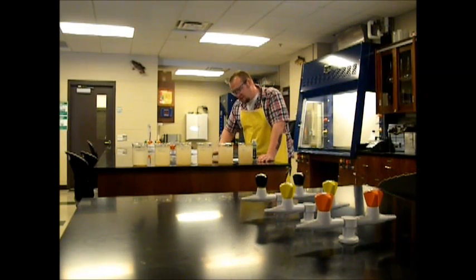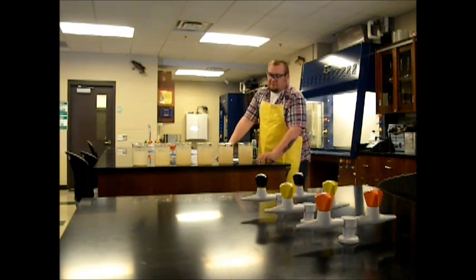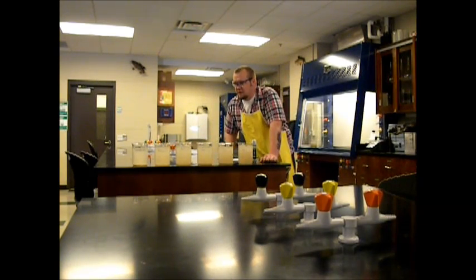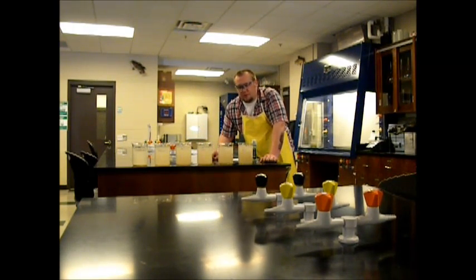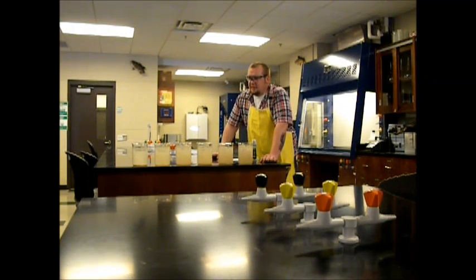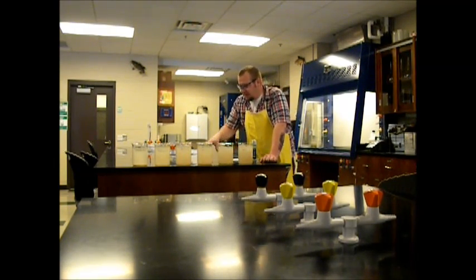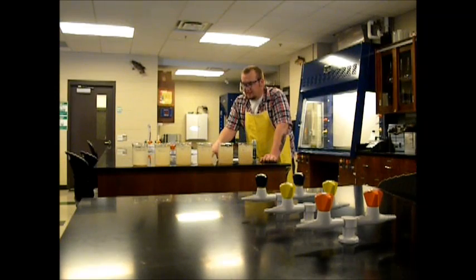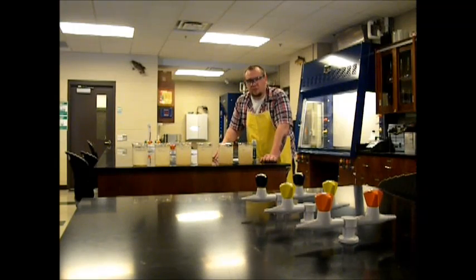The jar test has finally come to a close, and our samples have finished settling for the last 30 minutes. The pH has been tested along with the turbidity, and we can obviously see that there's been some form of change at the 5 to 25 milliliters of polymer added to our sample, compared to the higher doses of 75 and 50. Not the change we're looking for, but this is why a jar test conducted on a small level has its benefits — it doesn't cost a lot of money or time, and you can really pinpoint where you need to go and try again without it consuming a lot of your time.